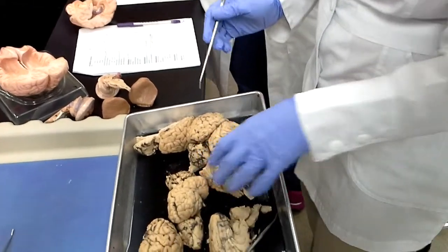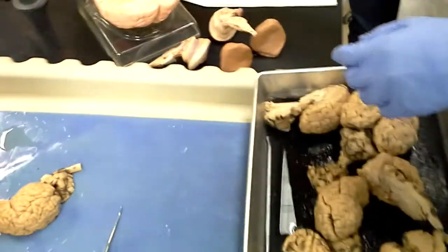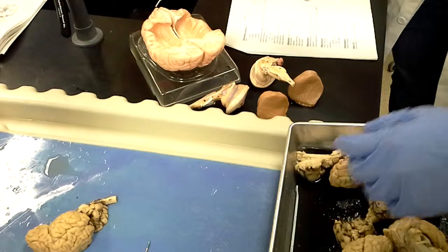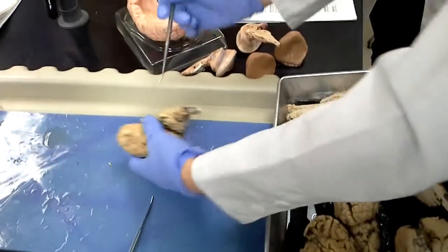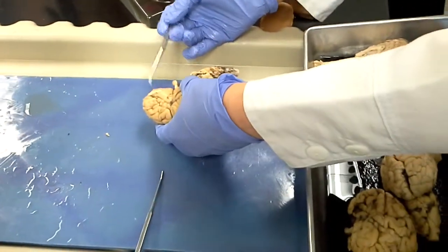Olfactory bulbs, we did have, I think, one, maybe two that showed these all right. On the underside of the frontal lobe, you'll see a tract, a nerve tract, and then the enlarged tip. That's the bulb. And the little tiny olfactory nerves would go into your nasal cavity from there. This one, we can sort of see that lighter colored tract and that end. It's a little frayed, but that's an olfactory bulb.